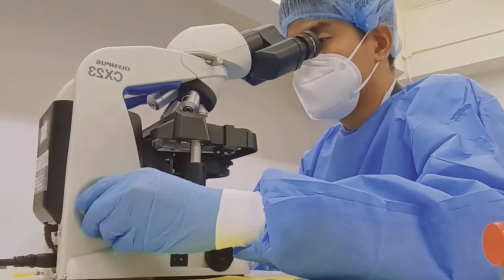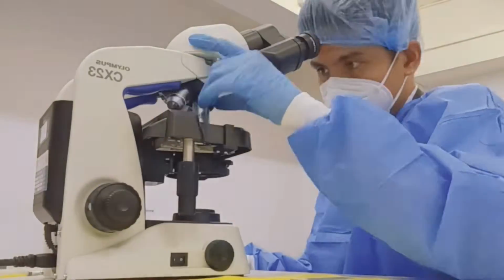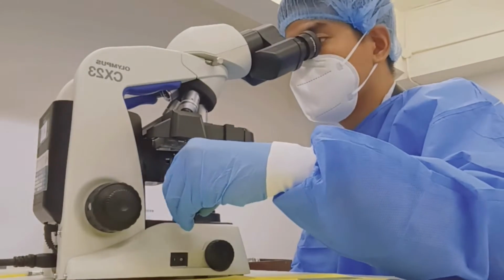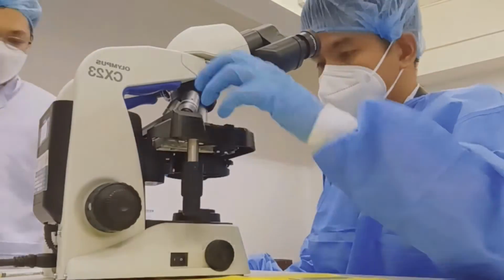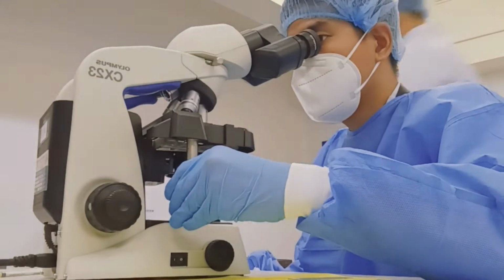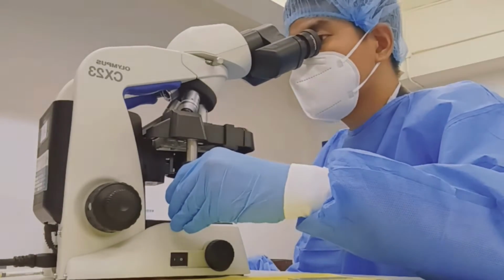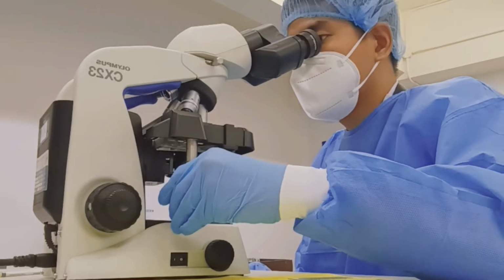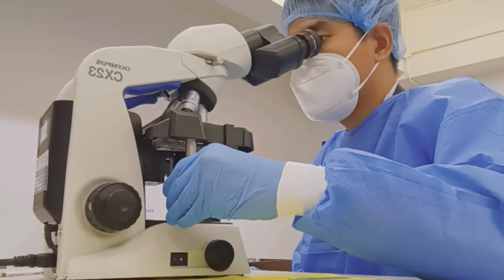Morphology is done to identify whether the sperm is in the normal form or has abnormalities. For grading, count 100 sperms and identify whether each is normal or has abnormalities. Also, take note of the abnormalities identified. For the recording of the results, get the percentage of the normal and abnormal sperms.